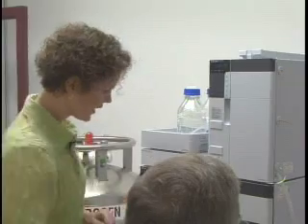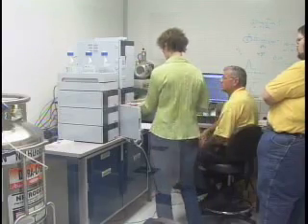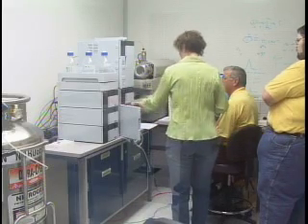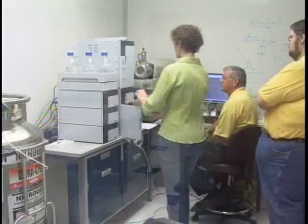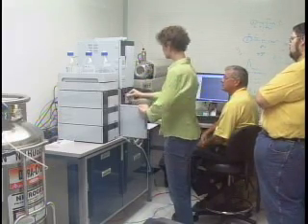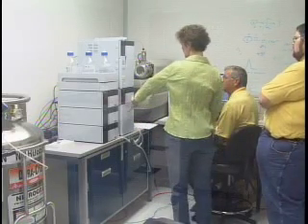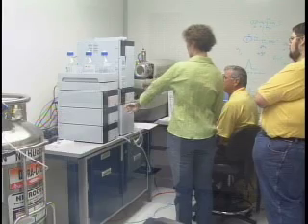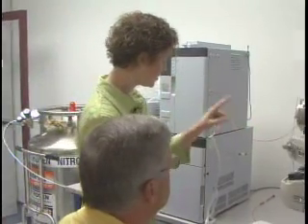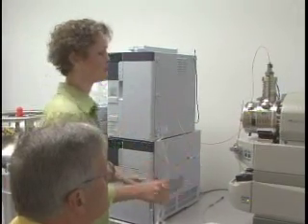The autosampler is here. It's difficult to see the components like the loop and the syringe, but they're in there. Most of the other parts are way in the back. The samples are inside the autosampler and they're injected onto the column where they're separated, then introduced into the mass spec side of the instrumentation.